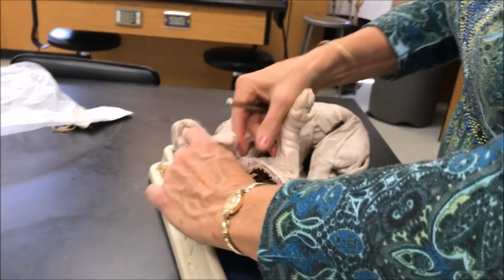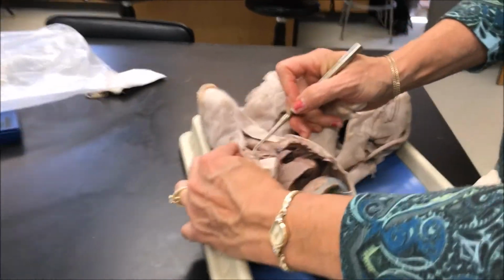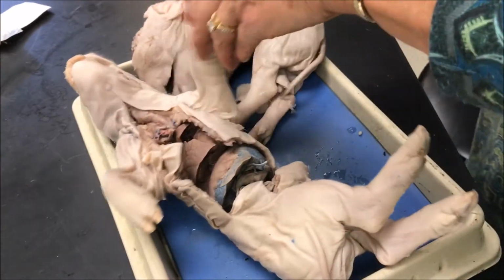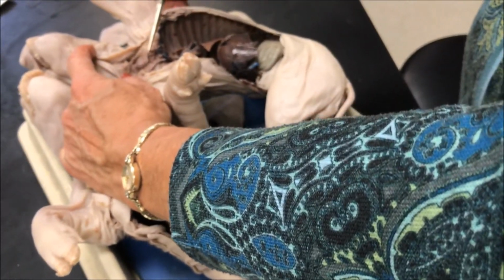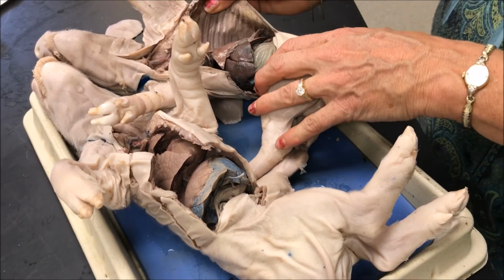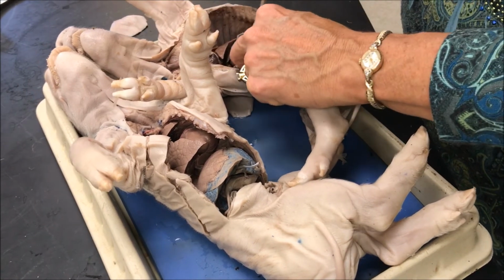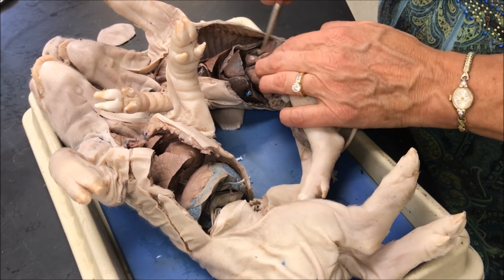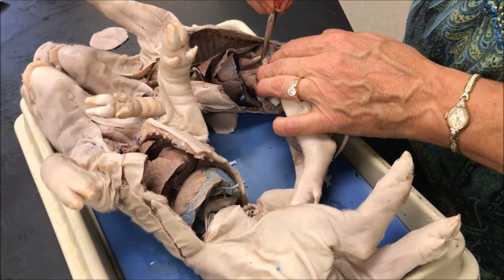Within the chest cavity is this gland called the thymus gland, which contains immunities for the fetal pig. This little brown bean that's missing on this pig is right below the larynx. Right here on the trachea is the thyroid gland that secretes thyroxine to regulate metabolism. The stomach has a characteristic J shape right here, and that is to help mechanically digest food. It has a low pH to help pepsin break down proteins.